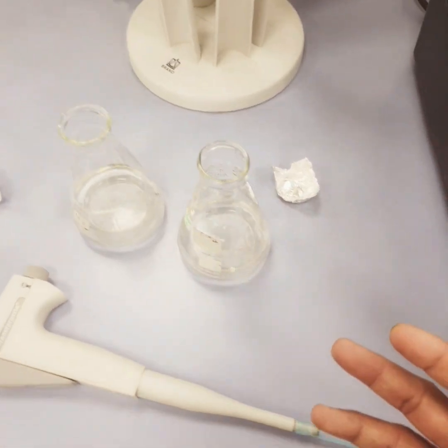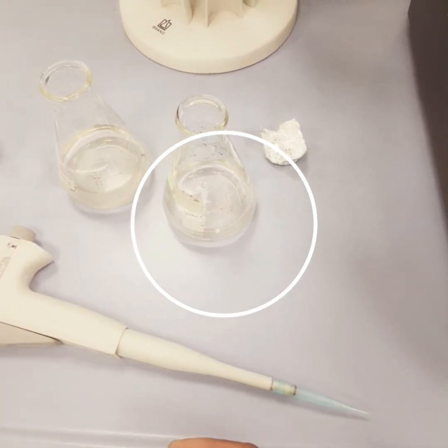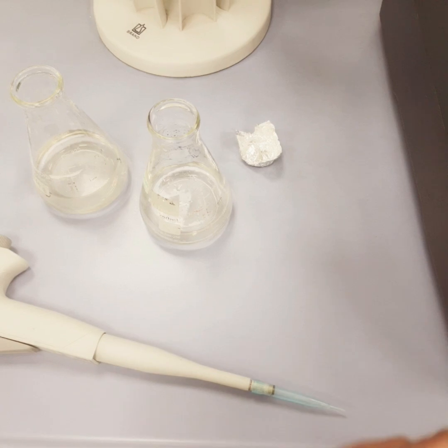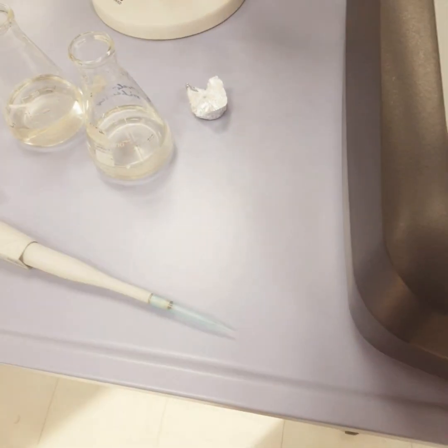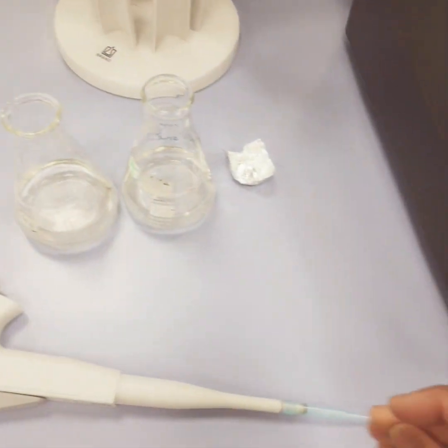You can try more. You can take the same amount of membrane and irradiate with UV, or soak in different kinds of eluent or desorbing agent. So this was all about the regeneration of the drug, tetracycline, the target pollutant, using membrane as an adsorbent.